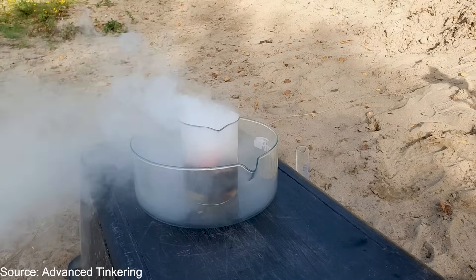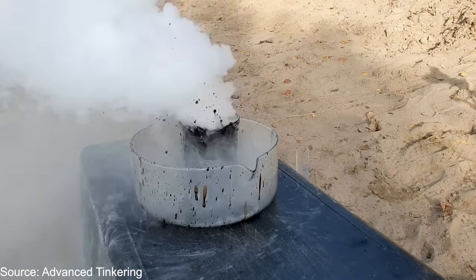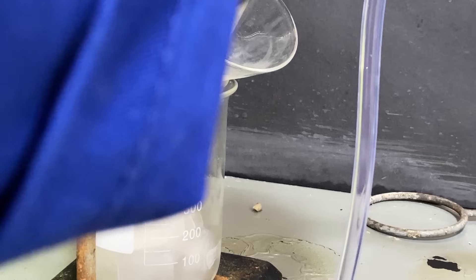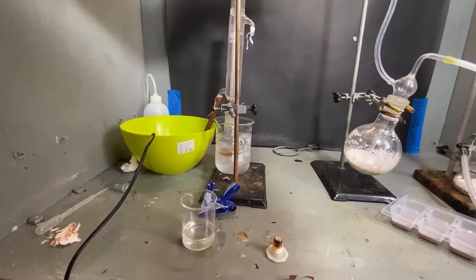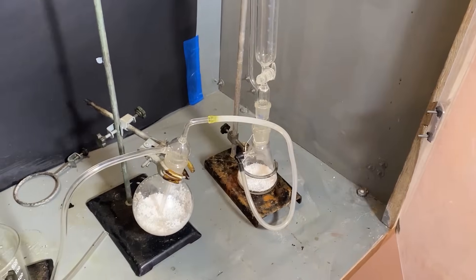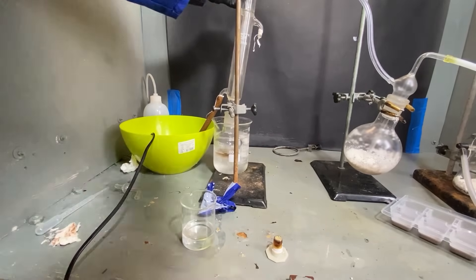To show you just how unreal it is, here's a clip from Advanced Tinkering, which dissolved a fruit in it — and you can see just how aggressive it is. To make our superacid, I've transferred the oleum into that same boiling flask which we used earlier. Then I fitted it with a condenser, and set up a quick HCl gas generator with a moisture scrubber. Finally, I put the output of the gas generator directly into the oleum.